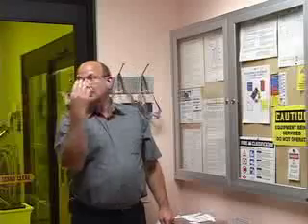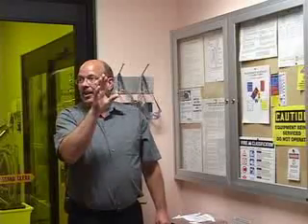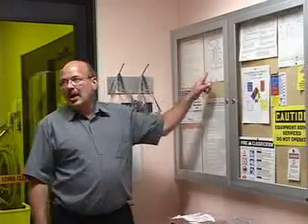The issue here is that this is not an emergency exit. We have prevailing west winds blowing here, and due to the location of our stack, if there was any settling of a toxic release through the stack, it would settle out in this area on the east end of the building. So that is why the evacuation route is always to the west. That is also why the TRC that I mentioned earlier is located at that end of the building.